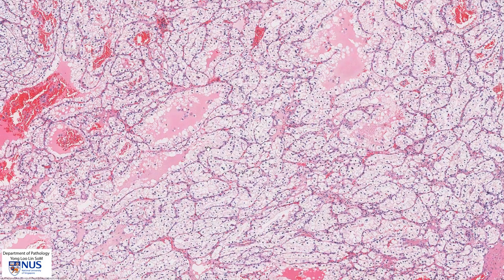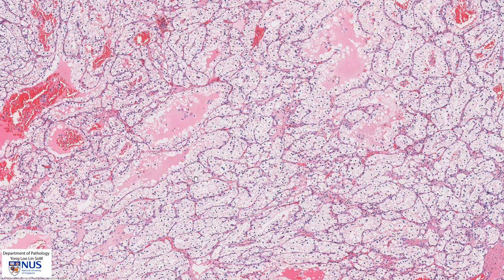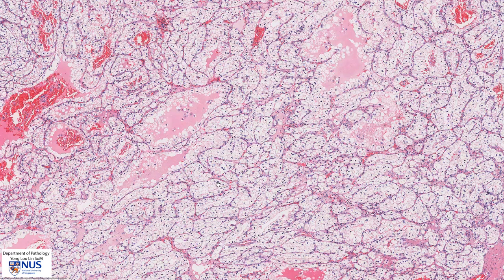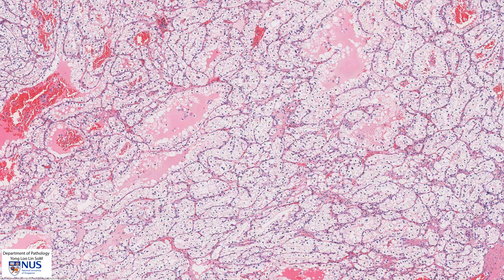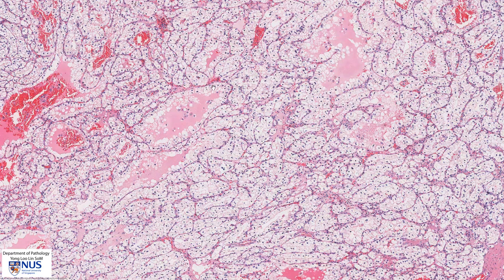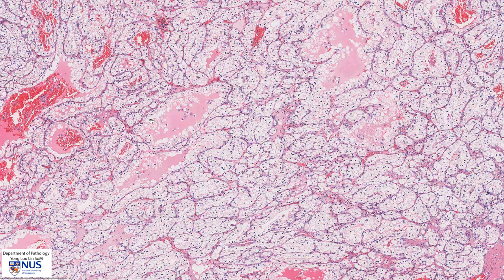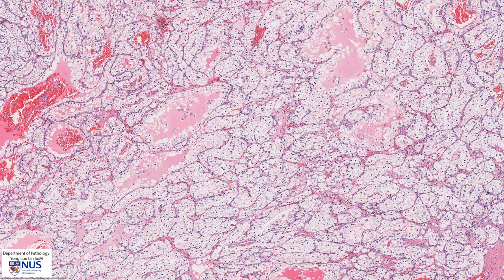As we go into higher magnification, we can see that this tumor is composed of nests and larger islands of cells. And in some areas, there is a tubular kind of architecture as well.